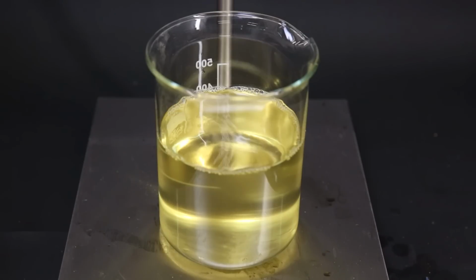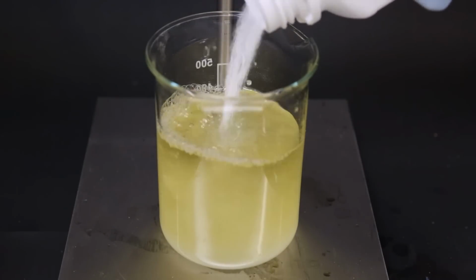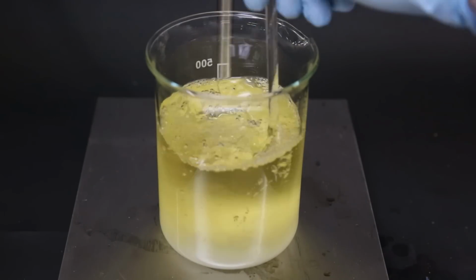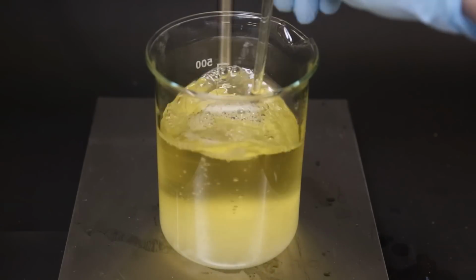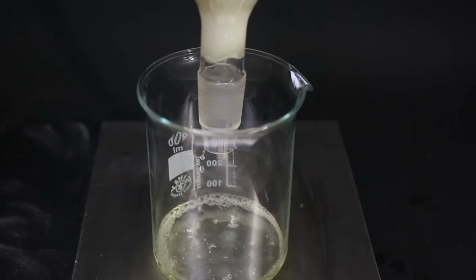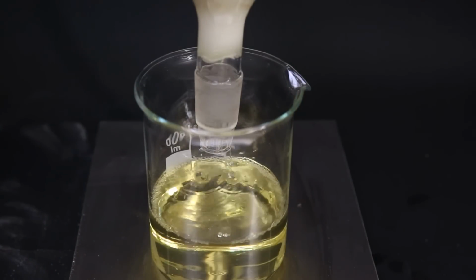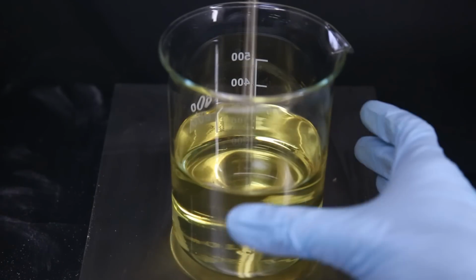After washing everything, I am left with about 400 ml of solution, which I will dry by pouring in some sodium sulfate and mixing it around. After letting it sit for a while, I filter the solution through some cotton and Celite. After everything is filtered through, I am left with a clear yellow solution.